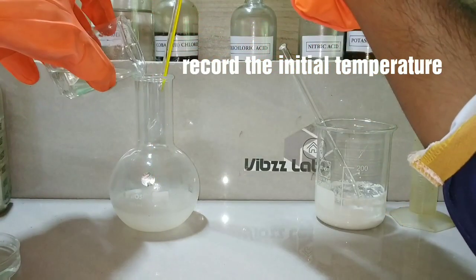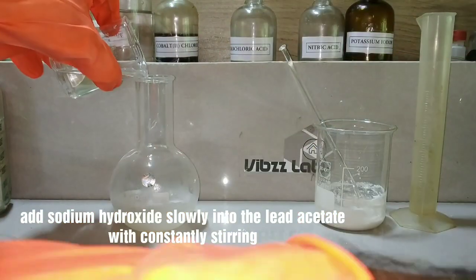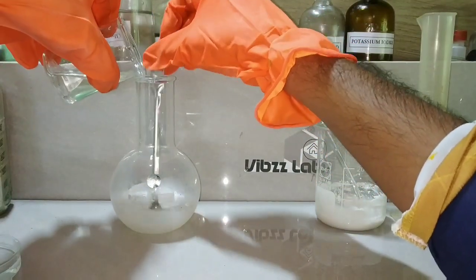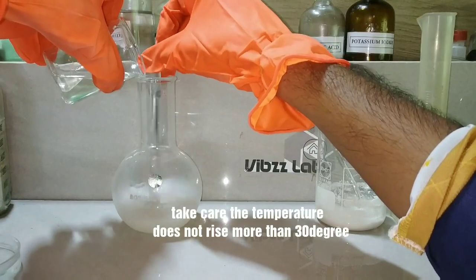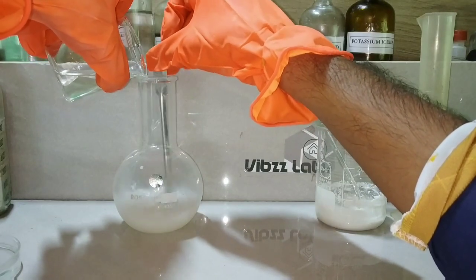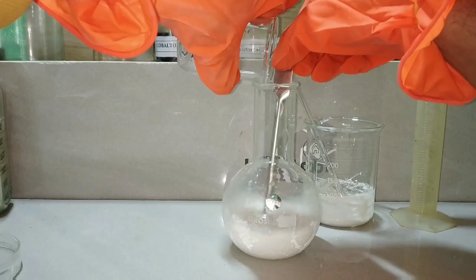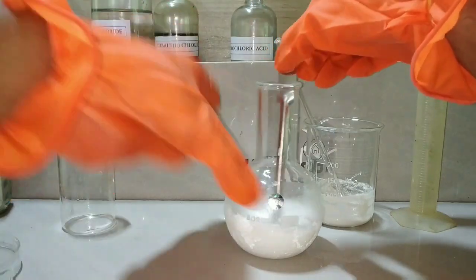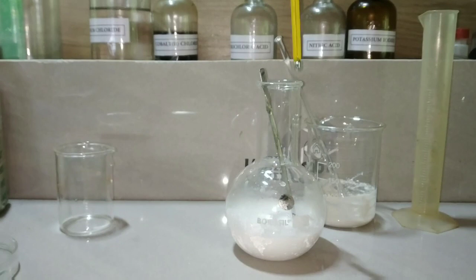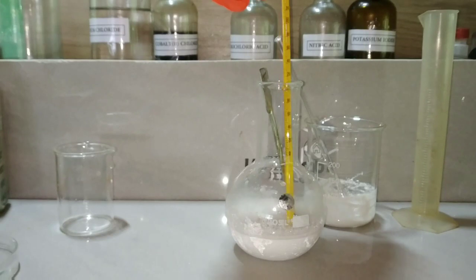Record the initial temperature of the lead acetate solution, which should be less than 30 degrees Celsius. Now we will be adding the sodium hydroxide very slowly into the lead acetate. You can see that there is formation of a white precipitate, which is lead hydroxide. Mix the contents very well and care should be taken that the temperature should not rise more than 30 degrees Celsius. After adding the whole sodium hydroxide solution, record the final temperature — it should be below 30 degrees.